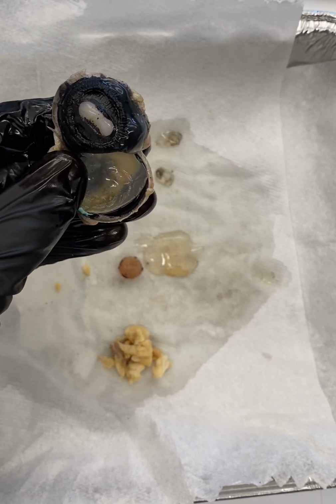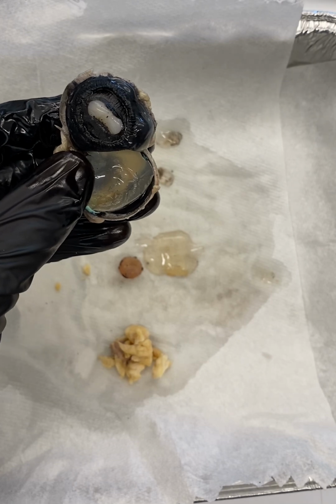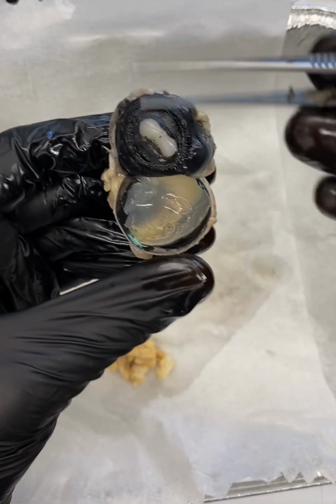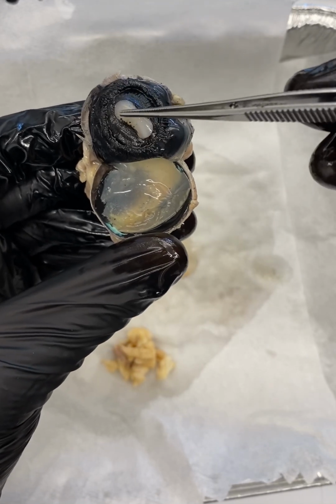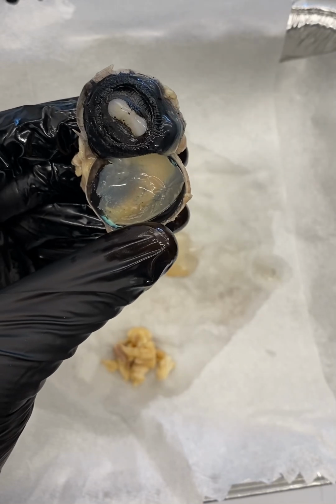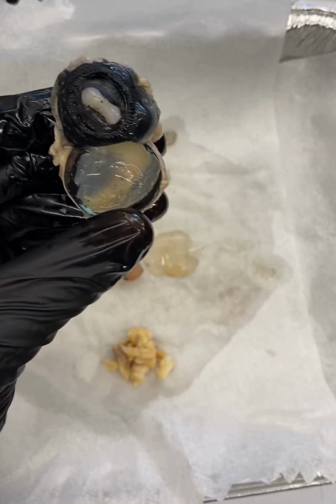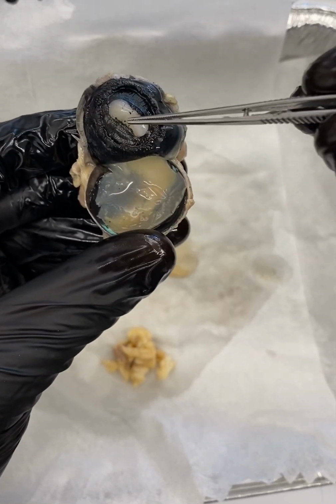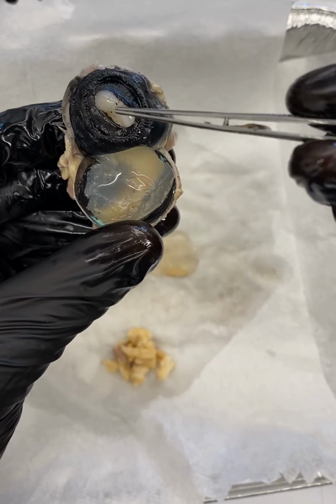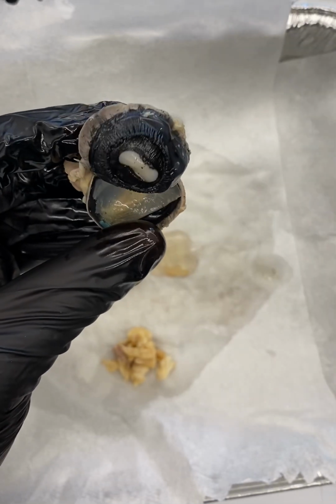If you've ever heard of glaucoma, glaucoma is an increase in the pressure, the intraocular pressure in the eye, and it can be due to an excess buildup and accumulation of aqueous humor in this anterior part of the eye. So for some reason, too much is being produced and/or it is being inefficiently drained out of the eye, okay? But that's what these ciliary processes produce.